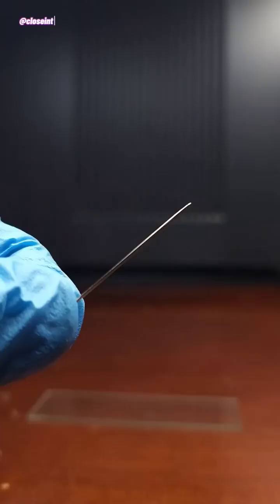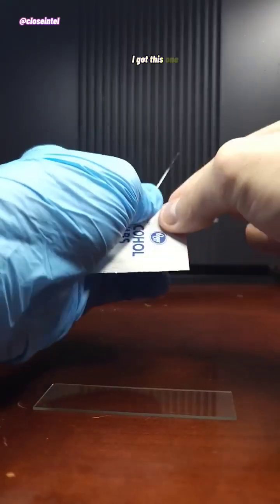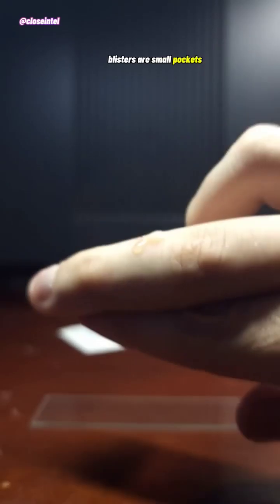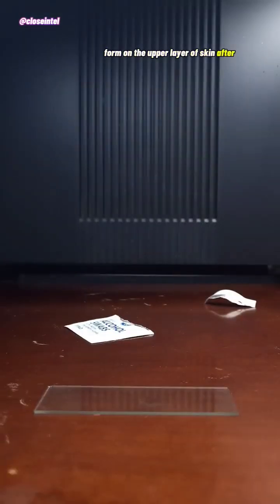Today I'm going to show you blister fluid under a microscope. I got this one from hot oil that got onto my finger while cooking some food. Blisters are small pockets of fluid that form on the upper layer of skin after it's been damaged.